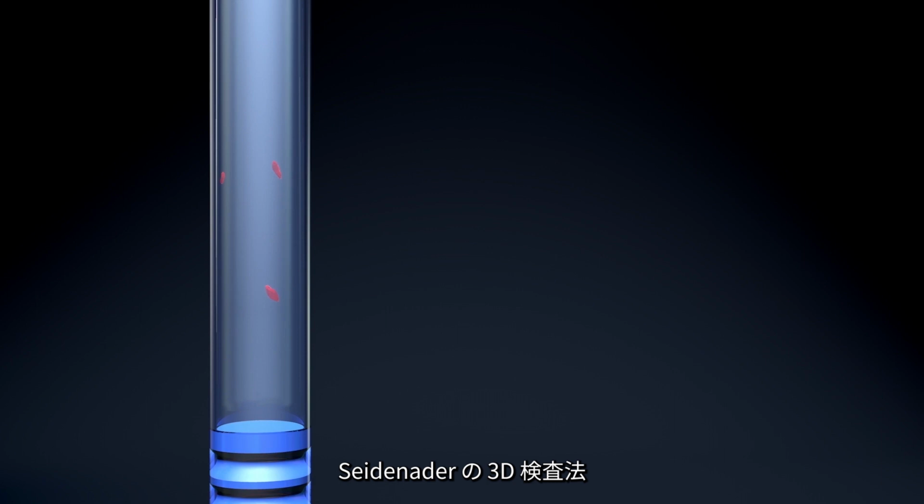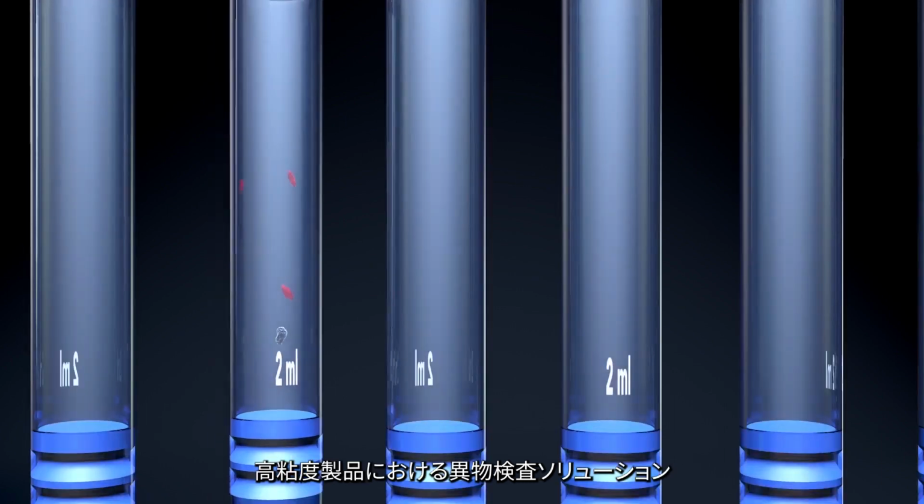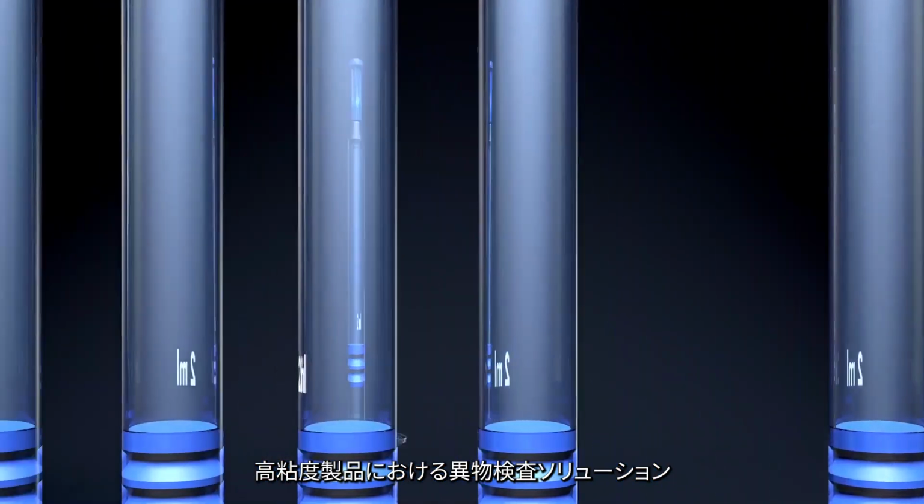Seidenader 3D inspection, the solution for particle detection in highly viscous products.